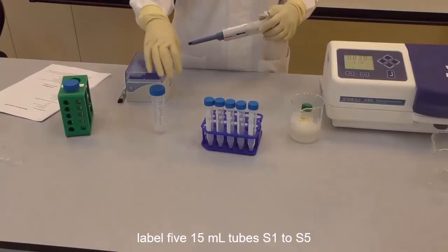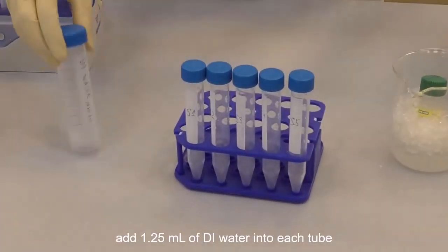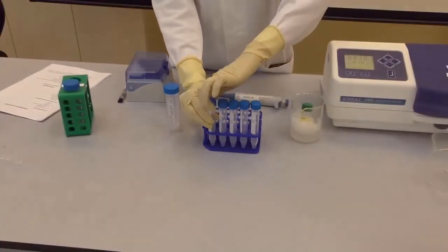Label 5 15 ml tubes S1 to S5 and add 1.25 ml of DI water into each of the tubes.